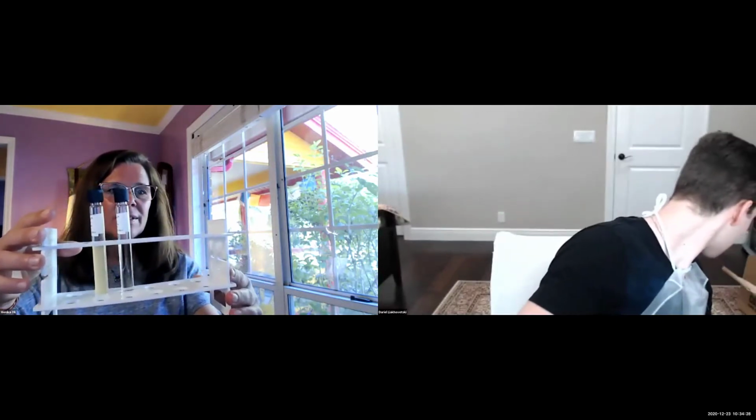Okay, so I'll put those off here. And I created this little box that holds the tubes from the kit. You should also have a rack. So your kit should come with a little tube rack. Yes, I believe I saw that. But putting this together, I just slapped this together really quickly, and it seems to be holding it together. That works as well, but for other experiments, we'll use that later on. Perfect. And I will put these here. Okay, so I have my two of these.